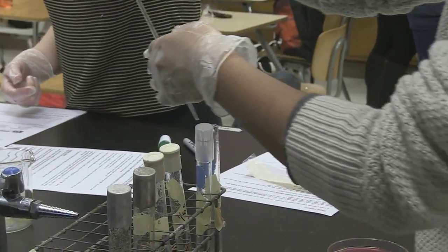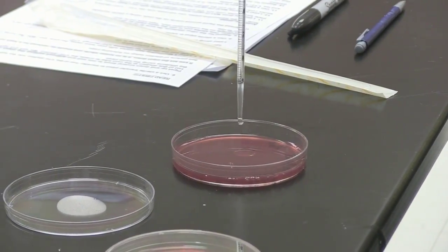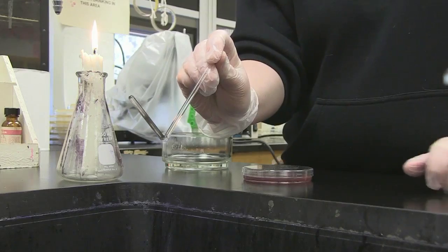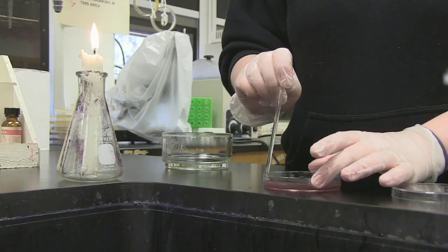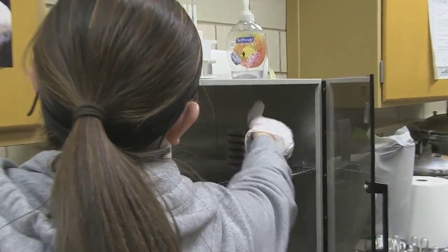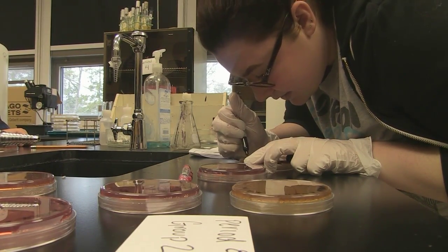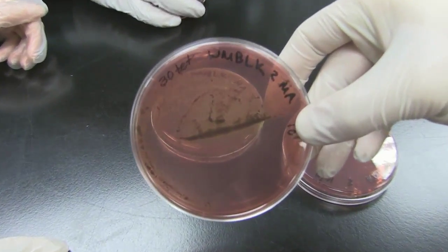After that, a measured amount of the bacterial solution is taken and put on each plate, and that sample is spread with what we call a cell spreader over the plate. They're put in the incubator to incubate for 24 hours and then 48 hours, and we check them across two days. The colonies, which each represent 10,000 bacteria, are counted. We also observe different kinds of bacteria because different gram-negative bacteria appear different on this type of agar.